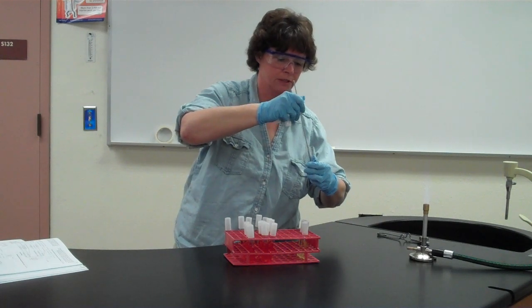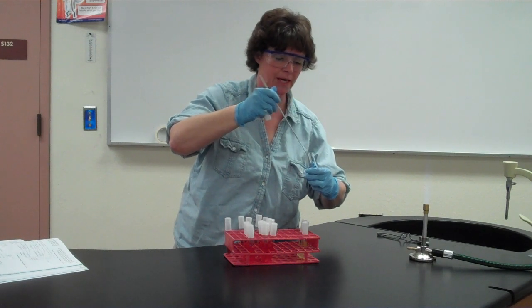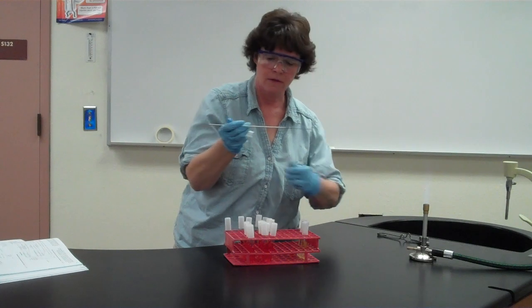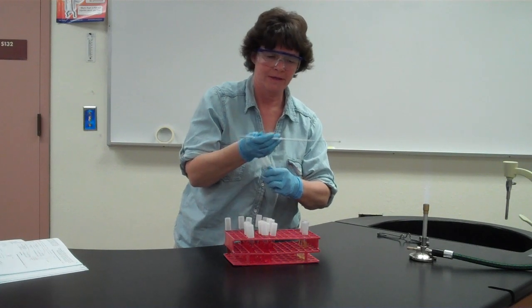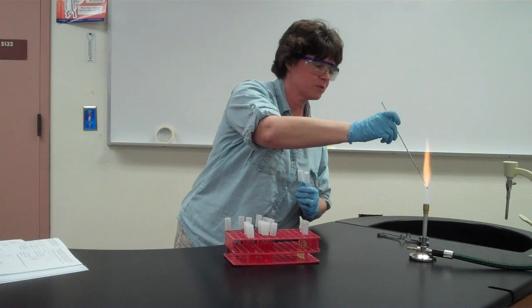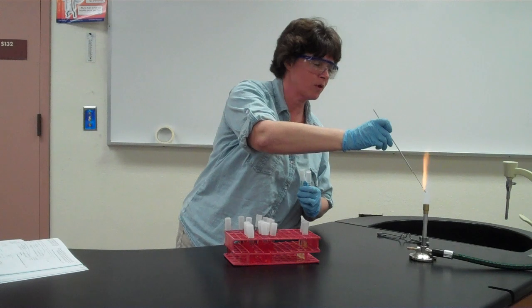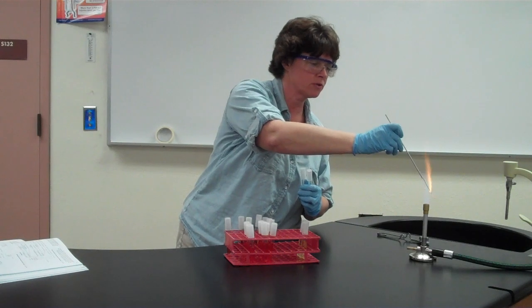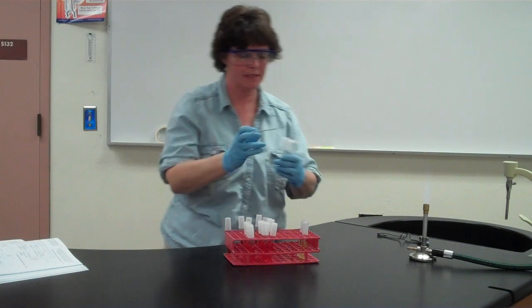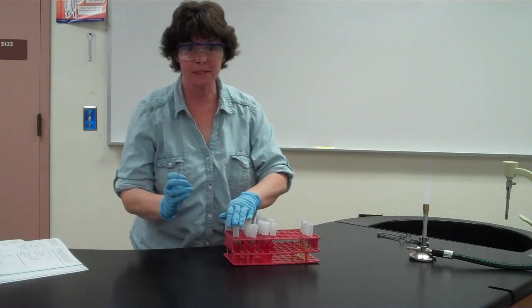What you want to do when you put it in there is not jiggle it too much, because you're going to introduce oxygen and maybe add a bubble. Okay, I got a big huge goober on there. Alright, so you're not going to do what I just did. I'm going to let my loop cool long enough. If you were to do that in real life, it's going to kill the bacteria and it's not going to grow. Okay? Ooh, that was nasty. Alright, so I'm going to put this one over here because it's done.